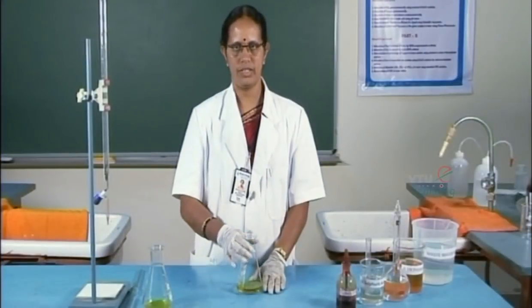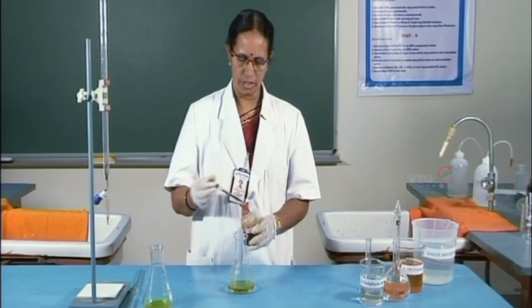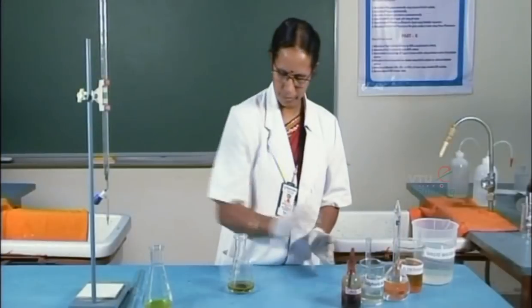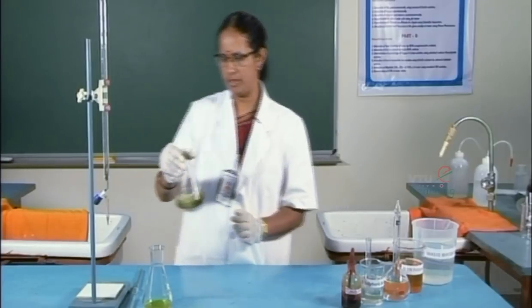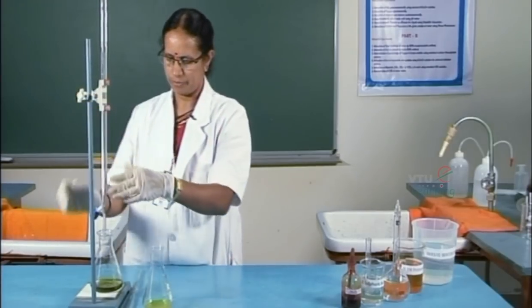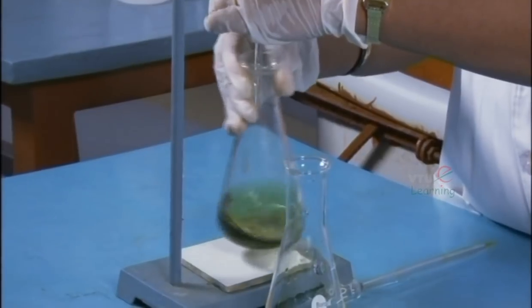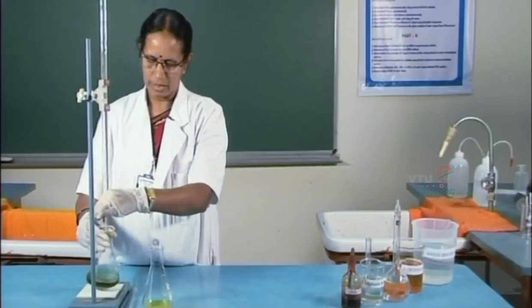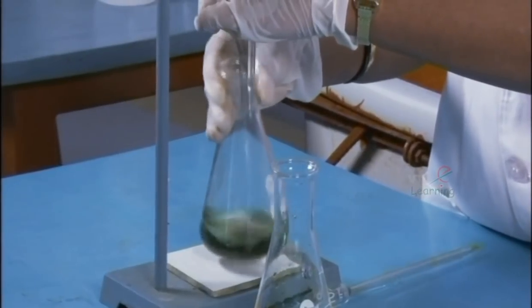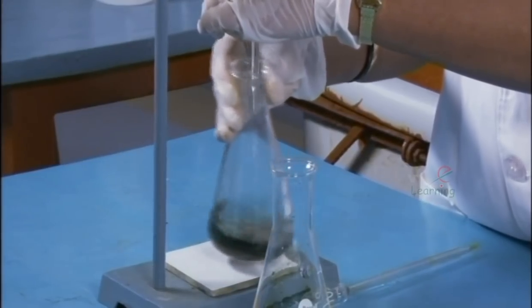Now, the solution is ready for further experiment. To this, 3 to 4 drops of ferroin indicator is added. The solution turns greenish color. Now, it is titrated against standard FAS solution. This titration is the back titration, which gives the estimation of unreacted potassium dichromate. Near the end point, the solution turns from green to reddish brown, because the oxidation state of the iron in the indicator changes.